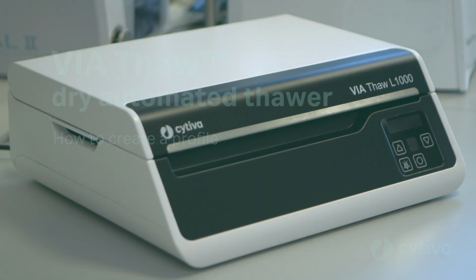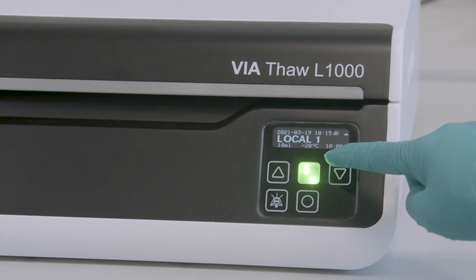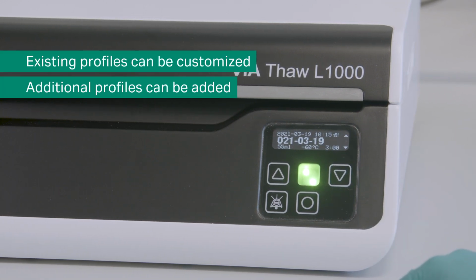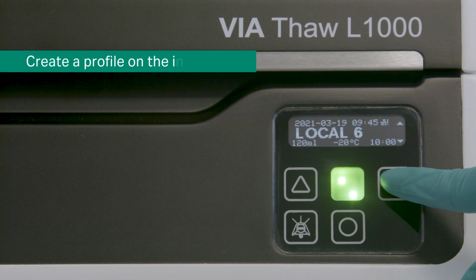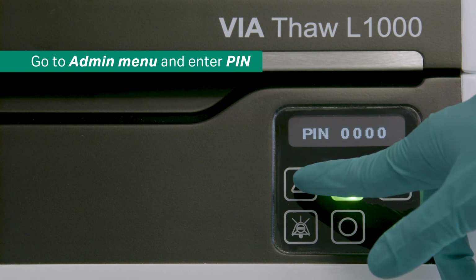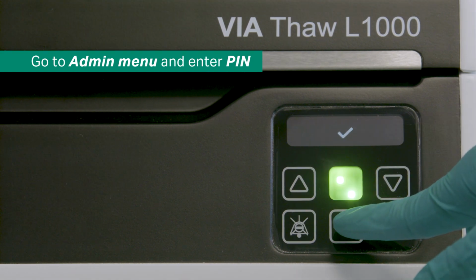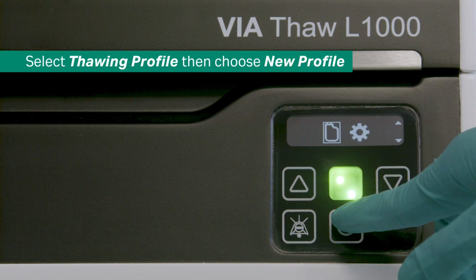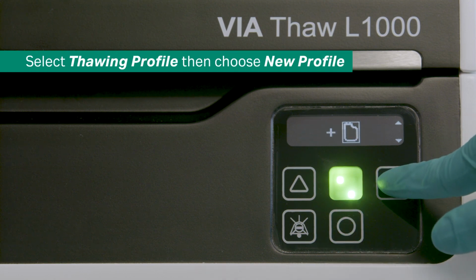Eight thawing profiles are preloaded and available on Thaw instruments. These profiles can be customized, and additional profiles can be added or created. Create a profile on the instrument. Admin users can create new thawing profiles by entering the admin menu and entering their PIN. Select the thawing profile menu, then choose New Profile.